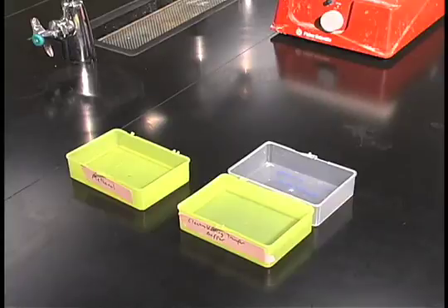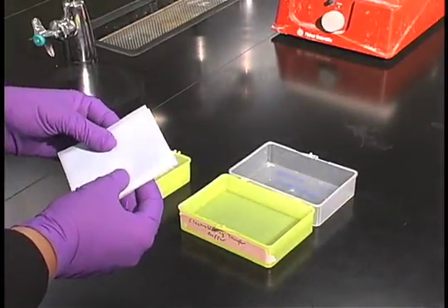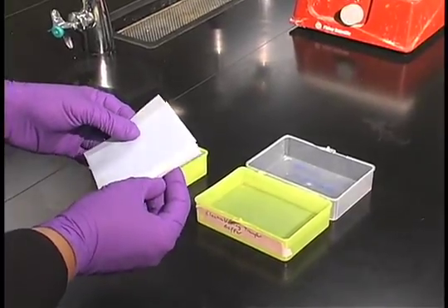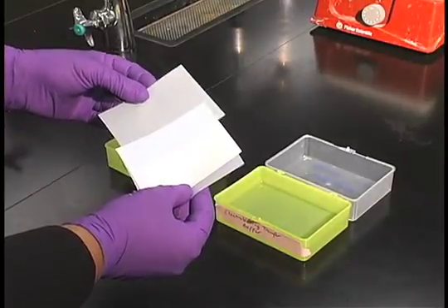For electroblotting proteins we'll use PVDF paper. This usually comes sandwiched between two other sheets of paper. The blue are just protective sheets, the white is the PVDF paper. Make sure you wear gloves before handling this because proteins from your fingers will bind irreversibly to that paper.